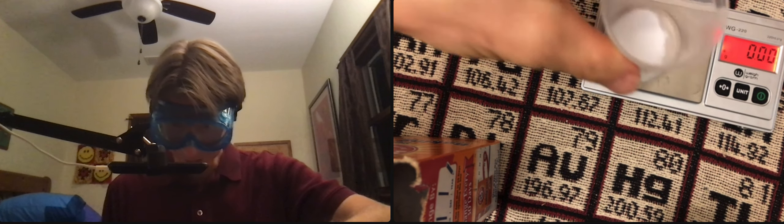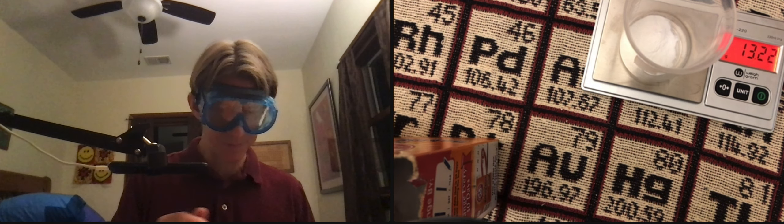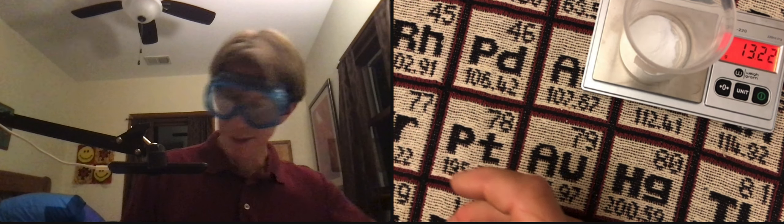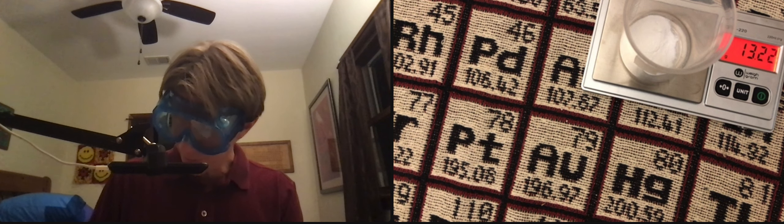Got the little dot. 13.2. So that's pretty good, actually. Actually, I don't want to contaminate that. 13.22 grams.